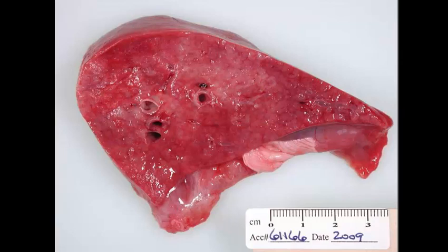Okay, let's go. We're looking at a section of lung. The lung is diffusely inflated, okay, has not collapsed. If we were to see it from the side, I bet we would see some nice rib impressions. Some people might say it's consolidated, however you want to put that. But the morphologic diagnosis that I'm going to put on this is going to be interstitial pneumonia. Those are the ones where they're not anteroventral, they're not bronchopneumonia, the lung is diffusely affected.